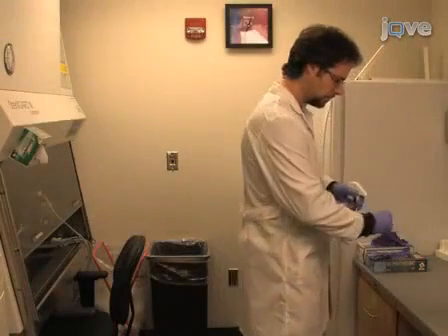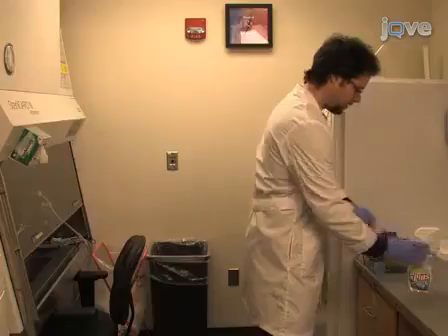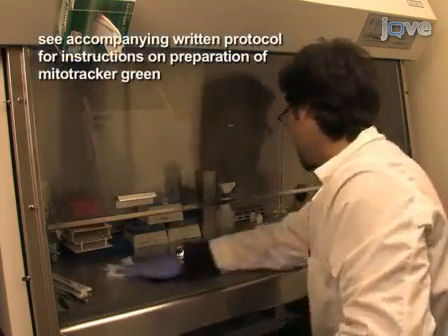Begin this procedure by sterilizing gloved hands with 70% ethanol. Then place a prepared 100 nanomolar stock solution of mitotracker green and pre-warmed BAEC cell culture medium in the hood with the light off and sterilize all surfaces.